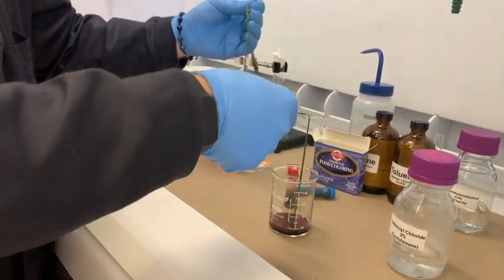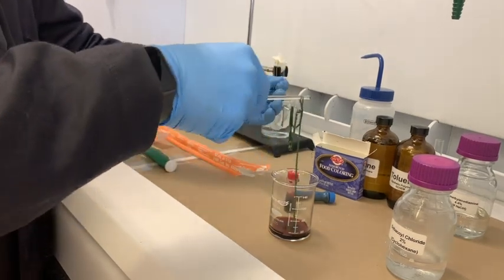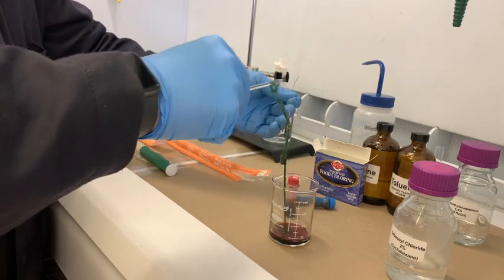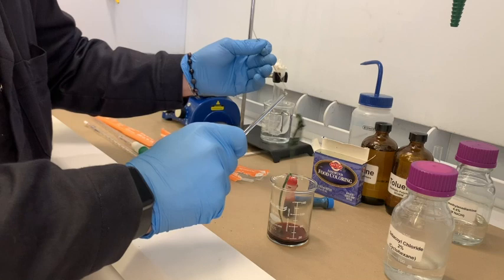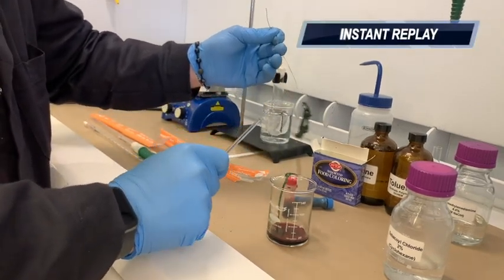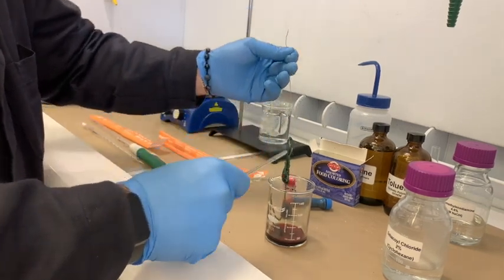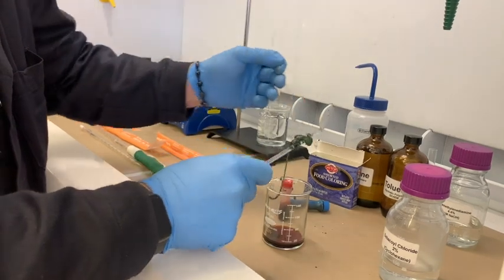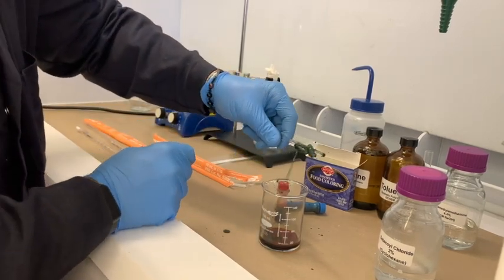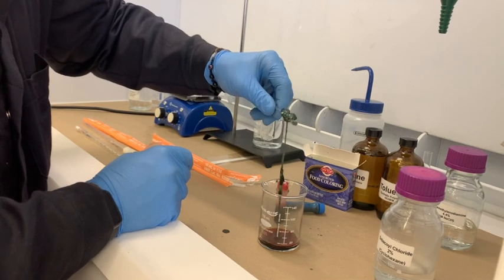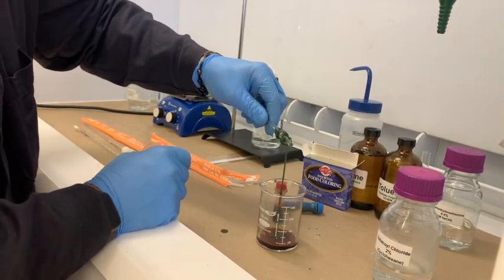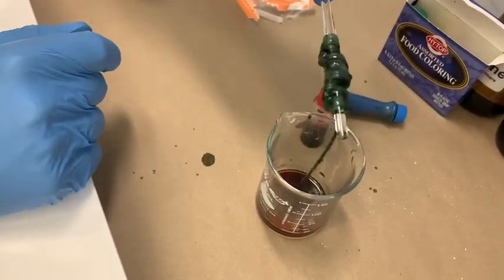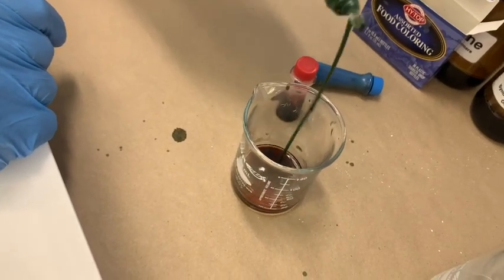So as you keep pulling the strand, you're going to keep pulling with it more of that nylon. Let me just park this before I make a huge mess here. Alright. I'm just going to stir this, just going to twist this around to make this a little safer. So as you keep pulling this nylon up, you're going to keep exposing the aqueous layer to the organic layer and you're going to keep forming nylon. And it's going to be this hideous green color that I've accidentally formed, but it's better than nothing.